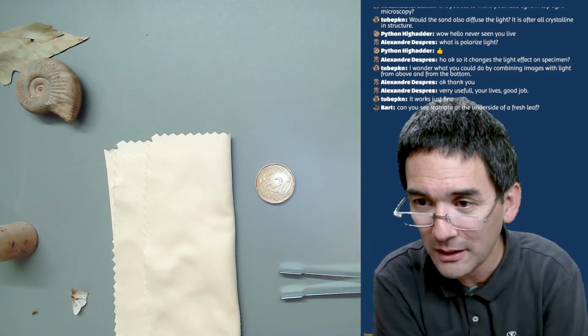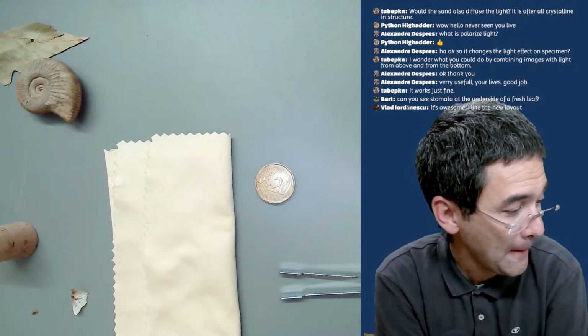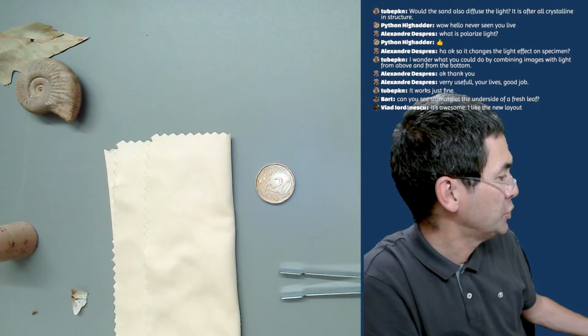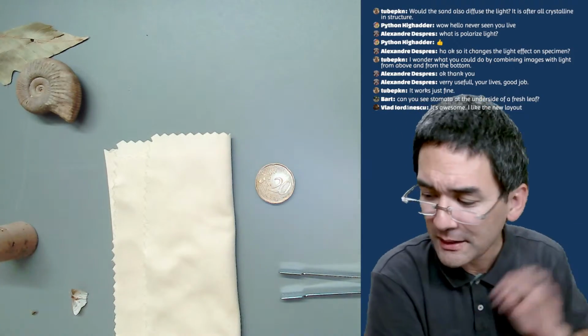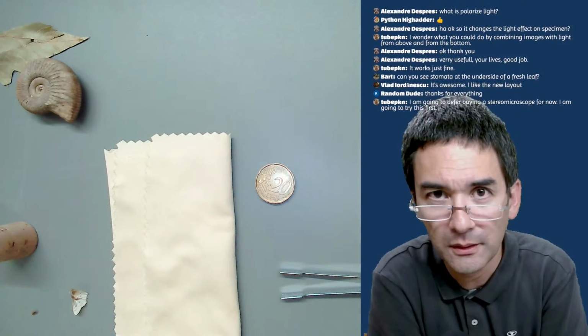But I think the question and the comment about polarized light is quite nice. Unfortunately, I don't have any slides here right now. Otherwise, I could have shown it to you. But I'm going to make a separate live stream or video concerning this.